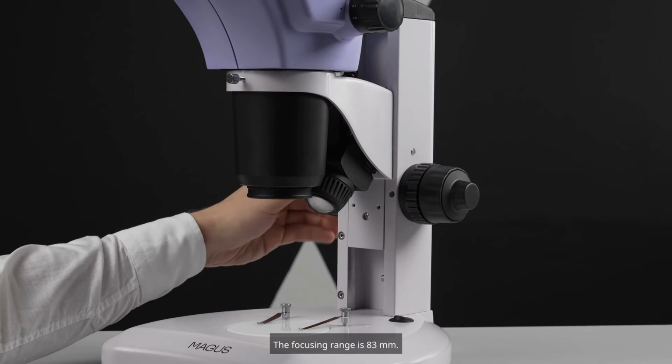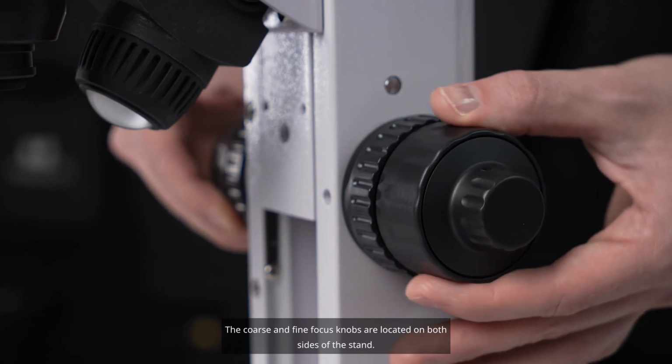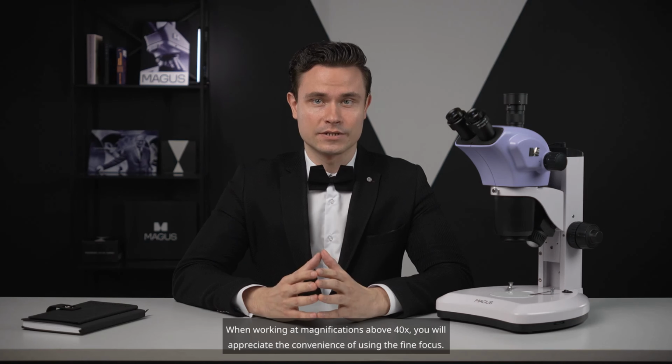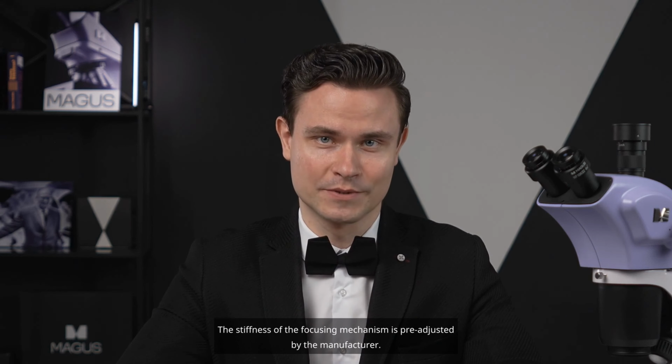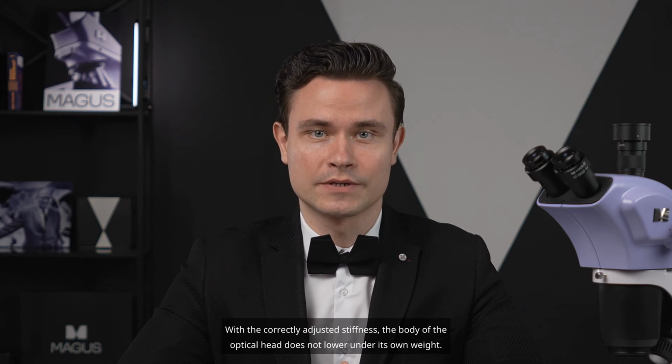The focusing range is 83 millimeters. The coarse and fine focus knobs are located on both sides of the stand. When working at magnifications above 40x, you will appreciate the convenience of using the fine focus. The stiffness of the focusing mechanism is pre-adjusted by the manufacturer. With the correctly adjusted stiffness, the body of the optical head does not lower under its own weight.